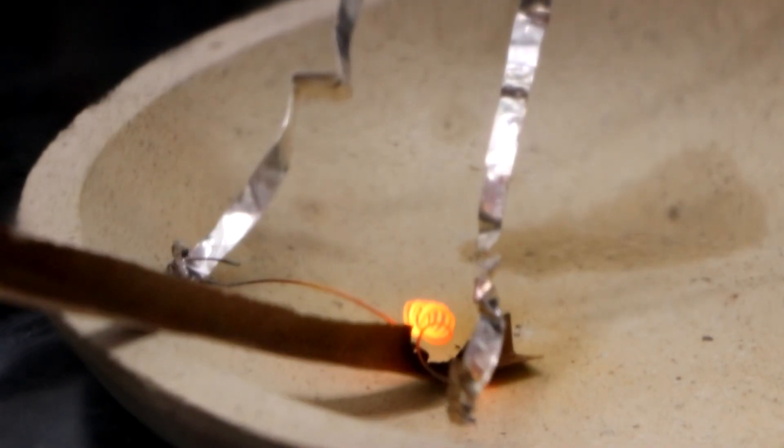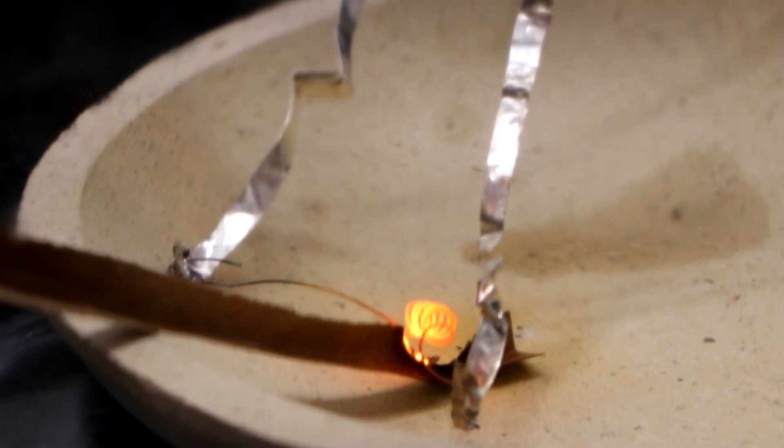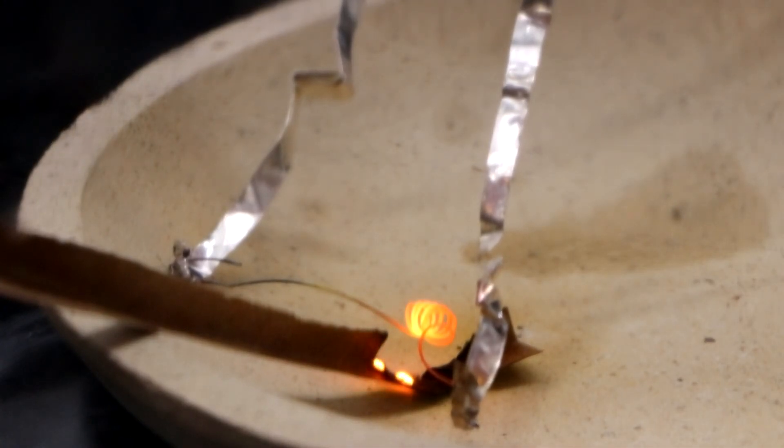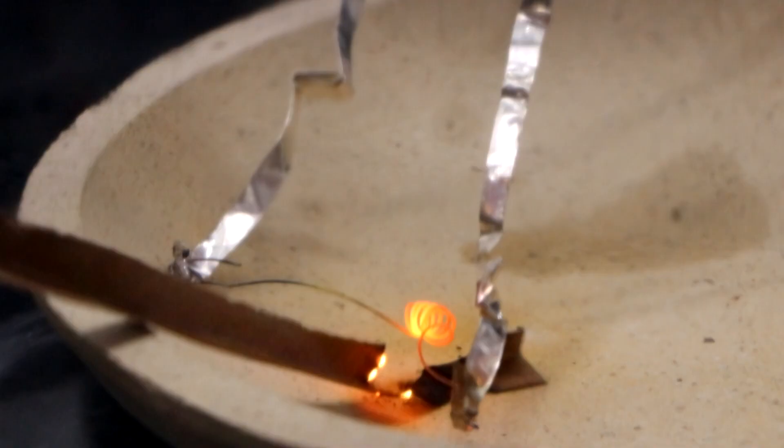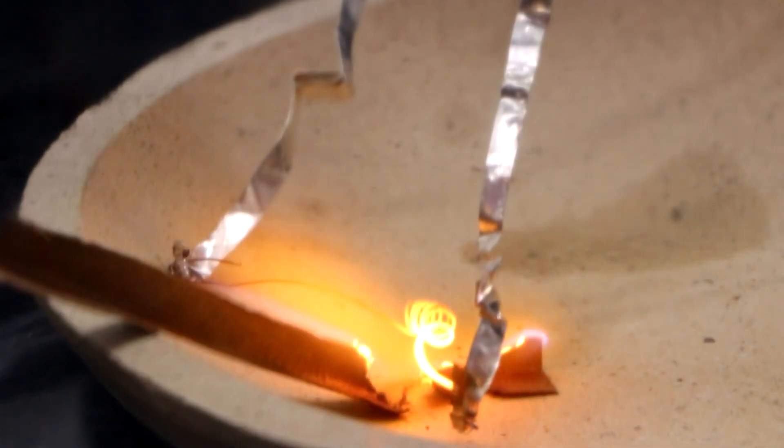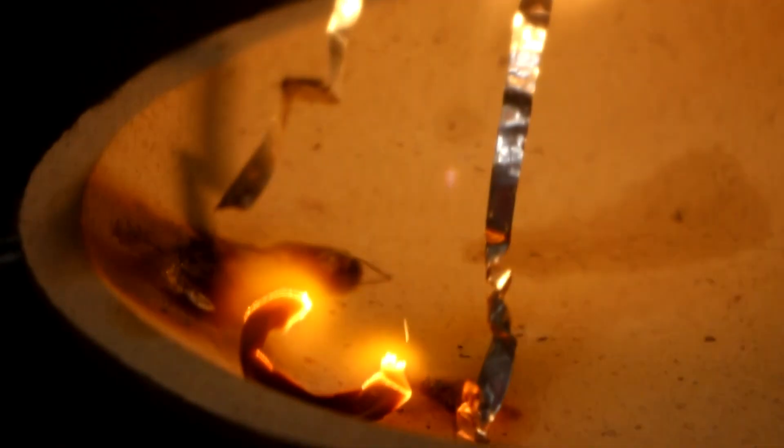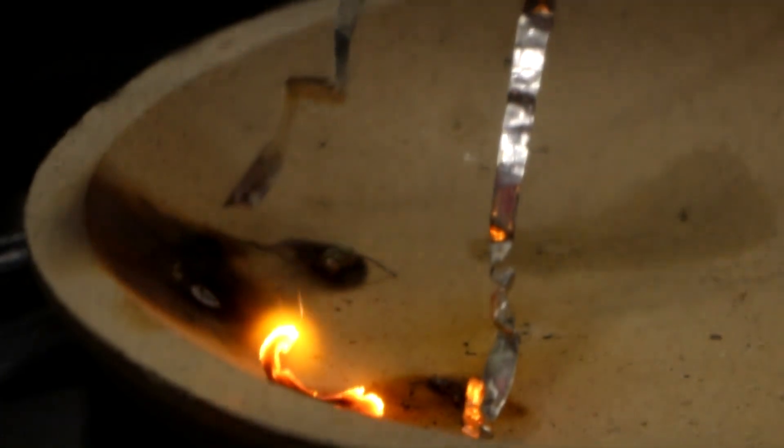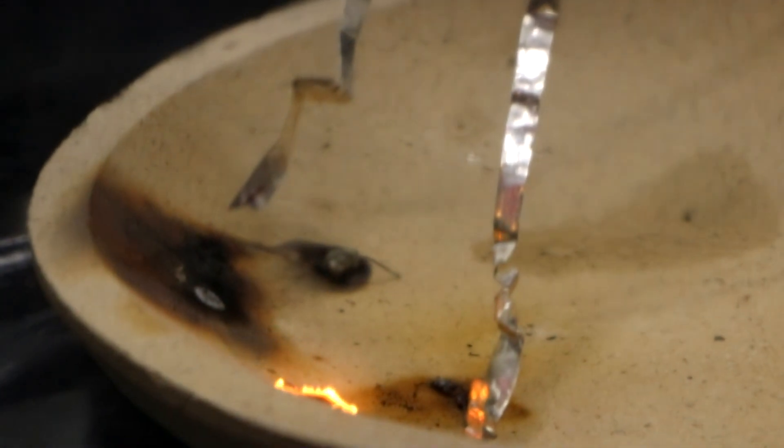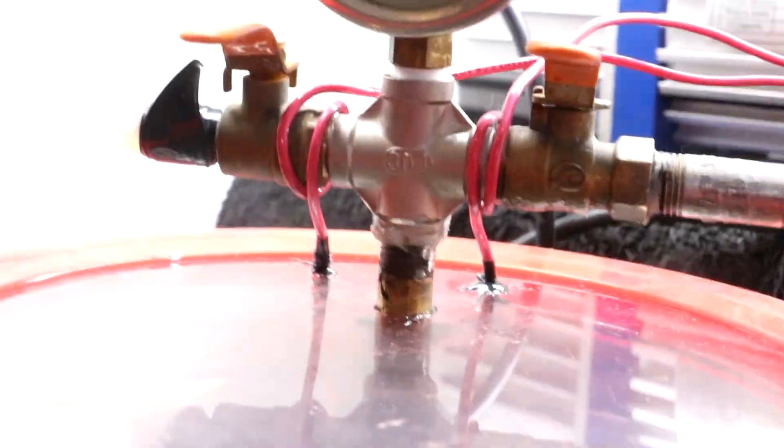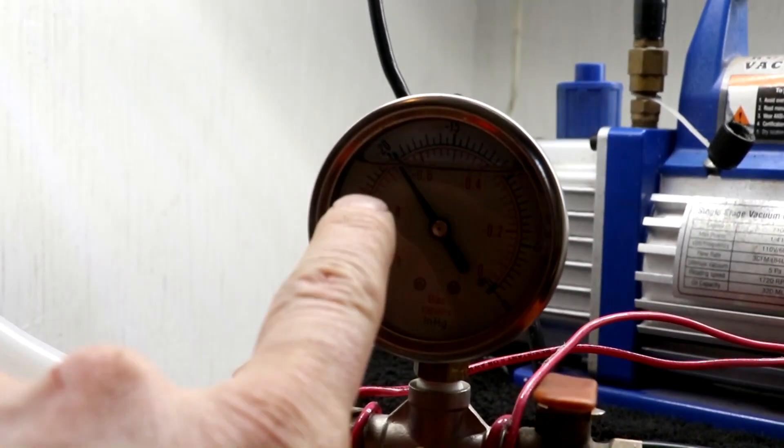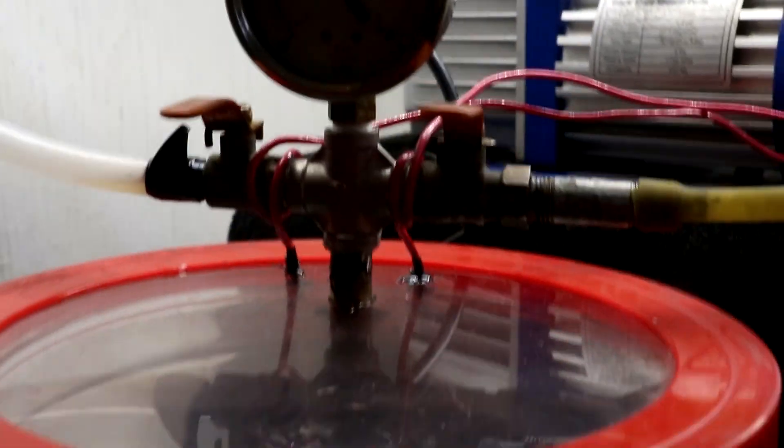Just like that. I'm going to add oxygen slowly. One inch, two inches. The reaction really started taking off at about the four inch mark.